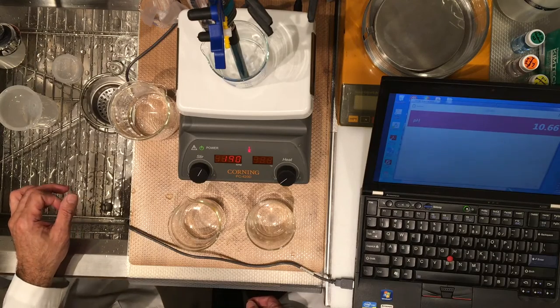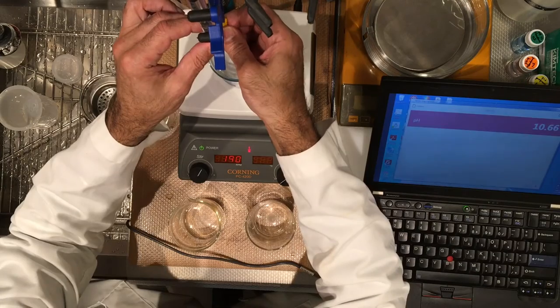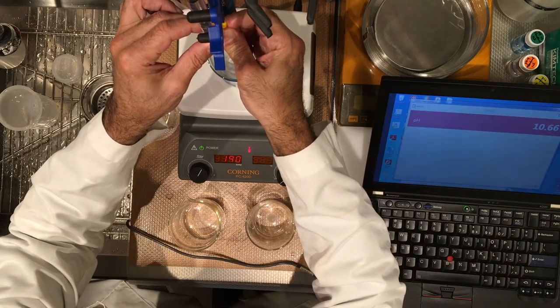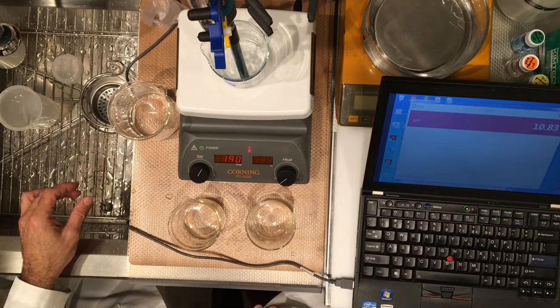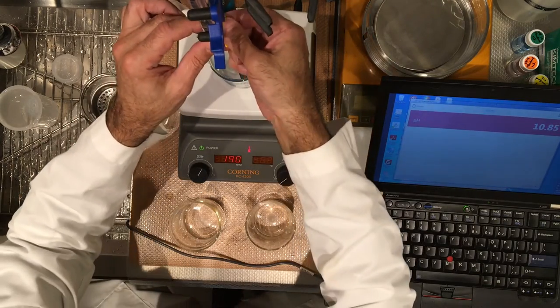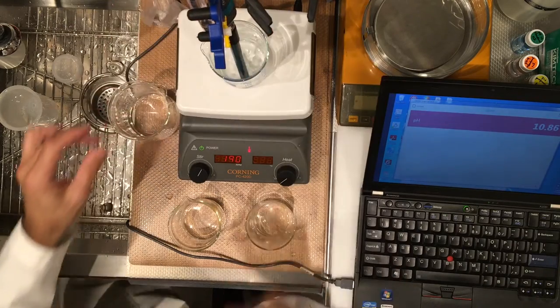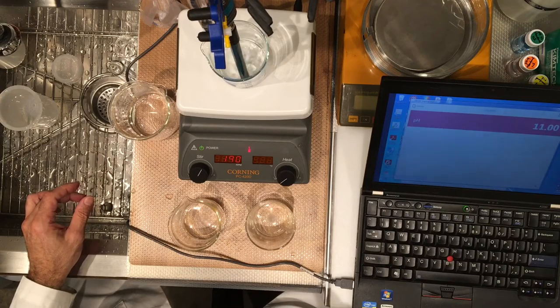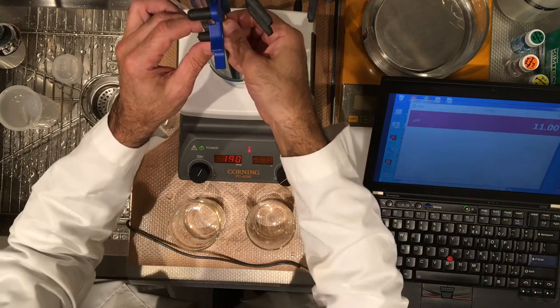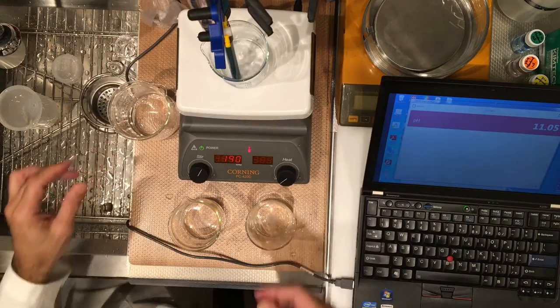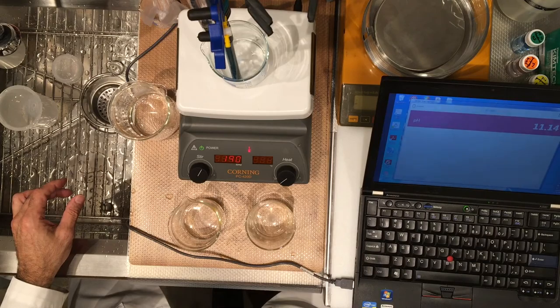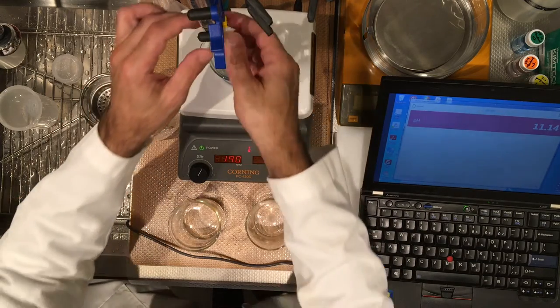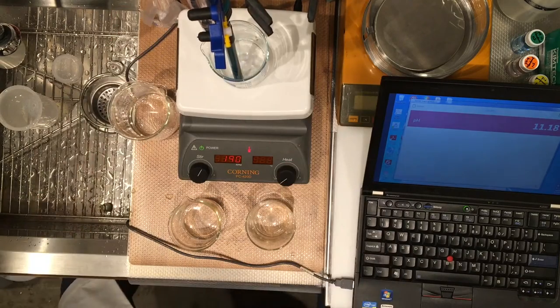This is 12 milliliters pH is 10.66 and I'm going to go increments of 0.5. 12.5. Record. 13. Record. 13.5. Record and 14. This is our last pH.